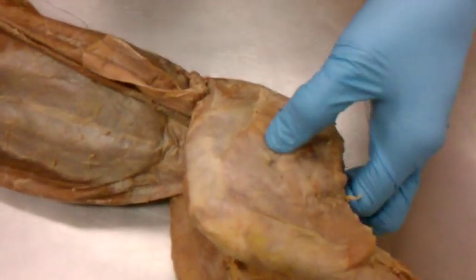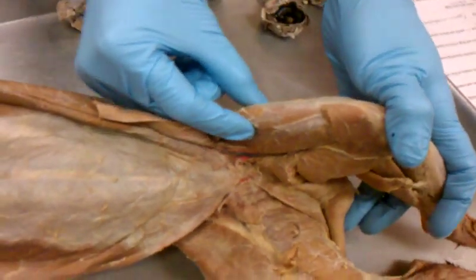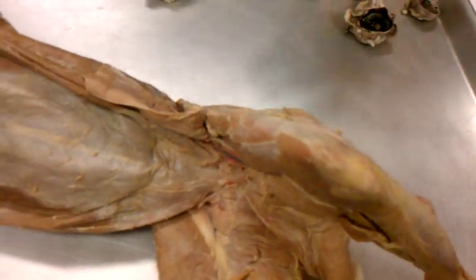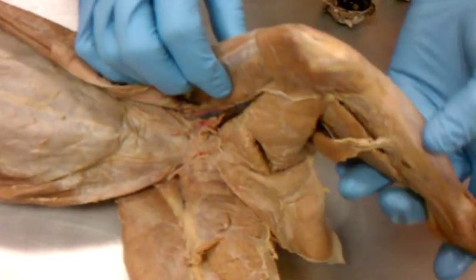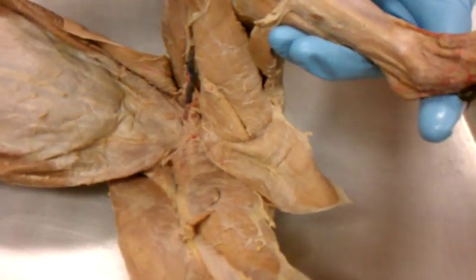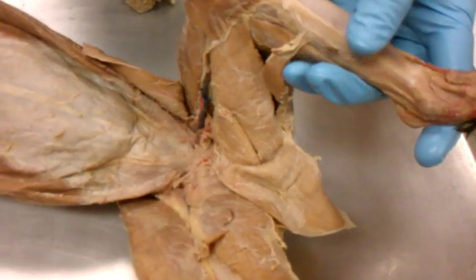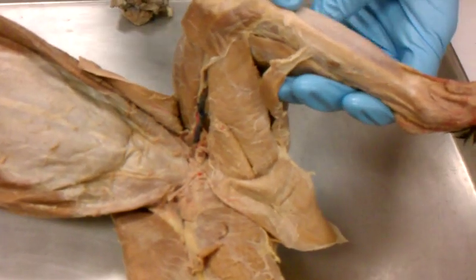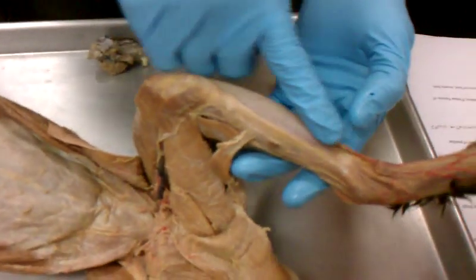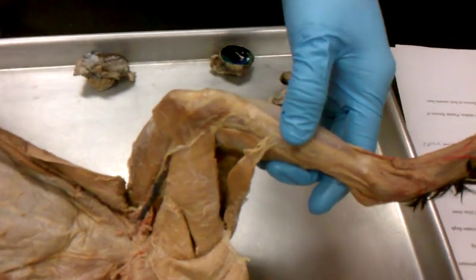So the biceps femoris. And then on the top of your leg, you have this one that has 4 heads. Remember? Yeah, your quads. So your quadriceps femoris that goes over your femur. And then you have 2 more. You have this one that's on the anterior portion of your tibia. So what is it called? Tibialis anterior. It's that one that if you go and feel your bone, it's on the side of your bone.